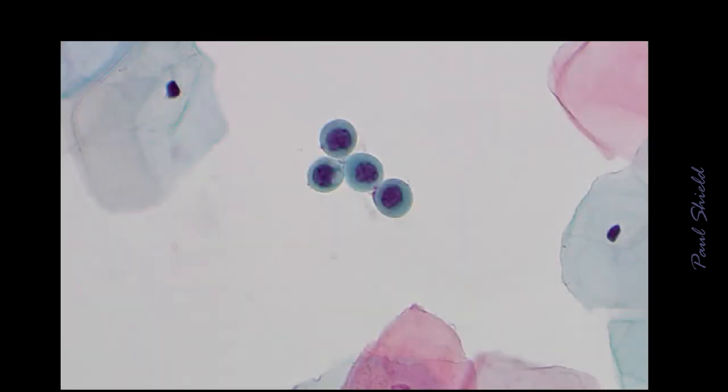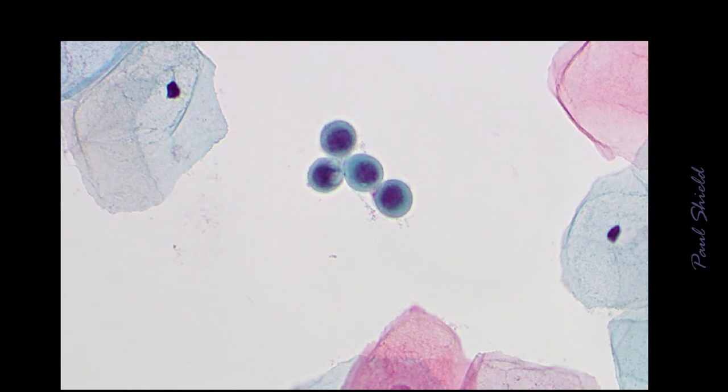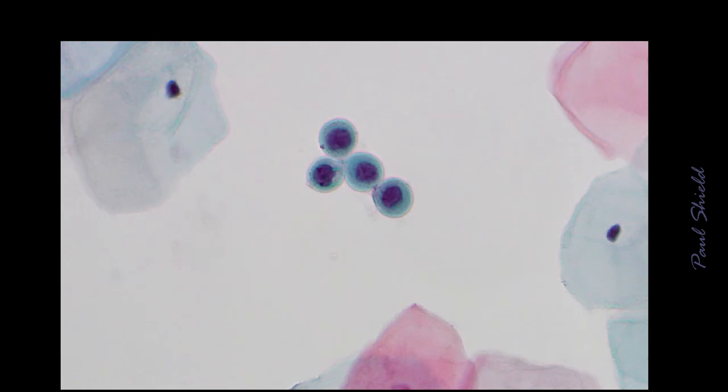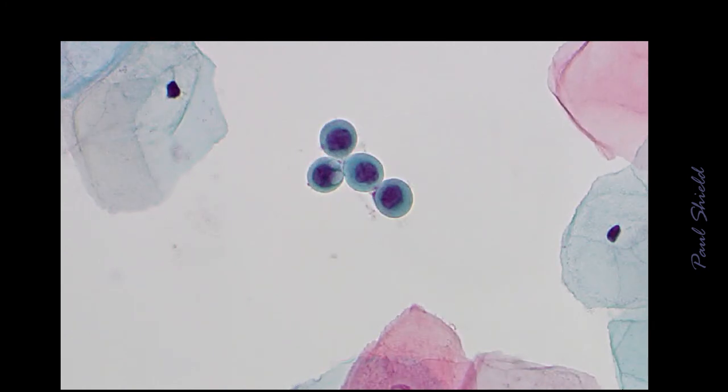This is where it gets quite hard. These are very immature metaplastic cells. So immature cells, if you like. So they have quite a high NC ratio. These guys are looking a little hyperchromatic as well, and they do have some slight irregularities to the nuclear membrane. One of them has a bit of a vacuole in it, so there's some degeneration probably present there. Sometimes these can be very hard to evaluate, and in those cases we might report it as possible high-grade HSIL.